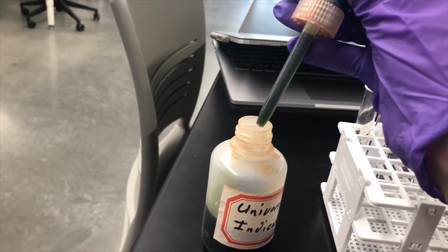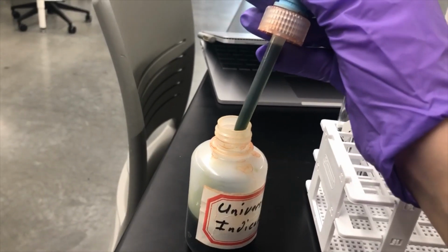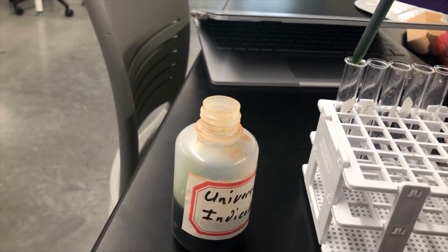Okay, so let's just drop in a few drops here.